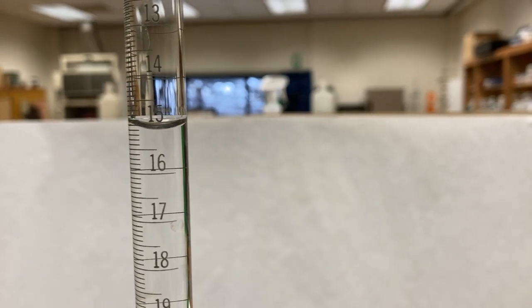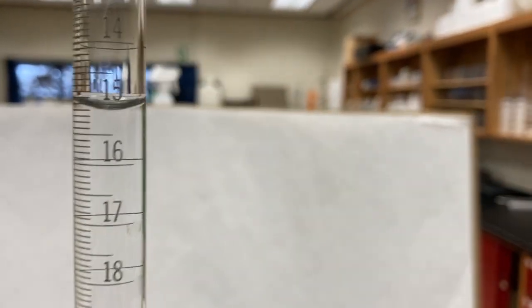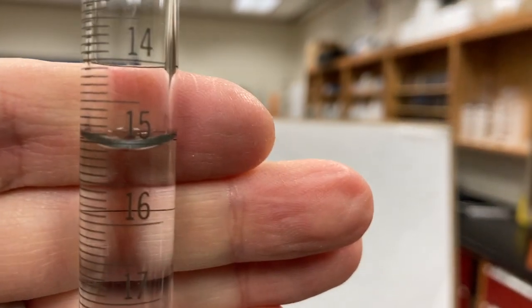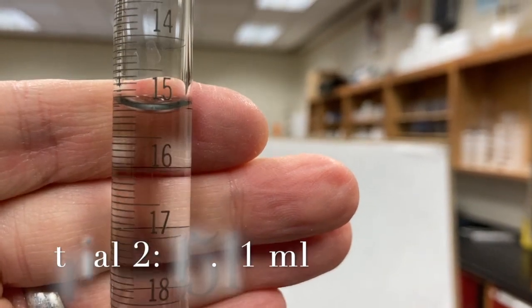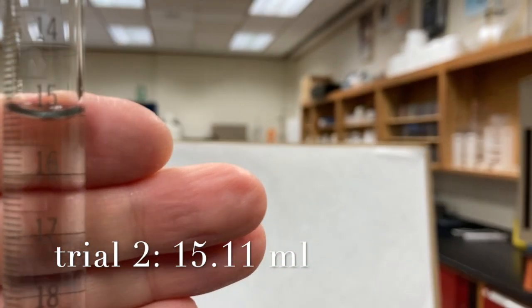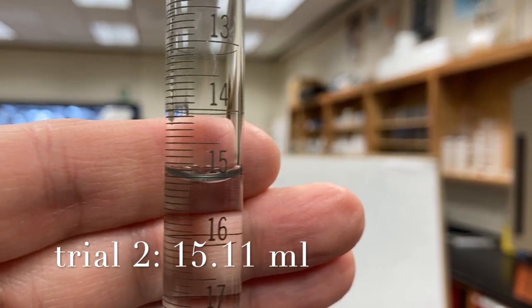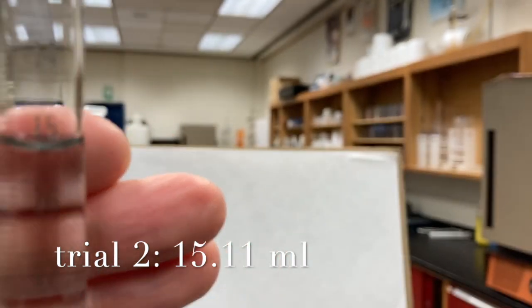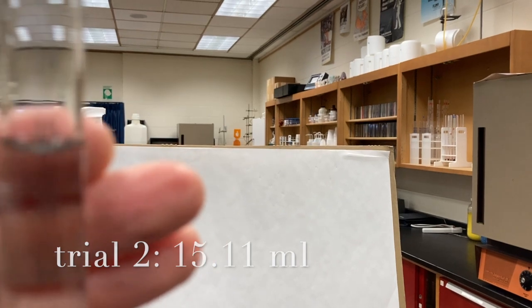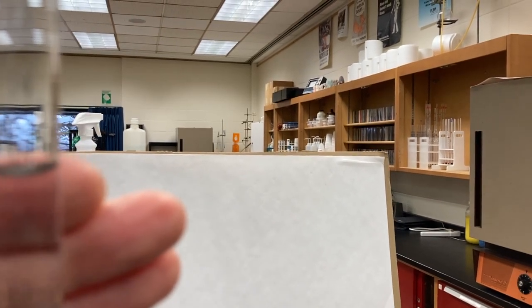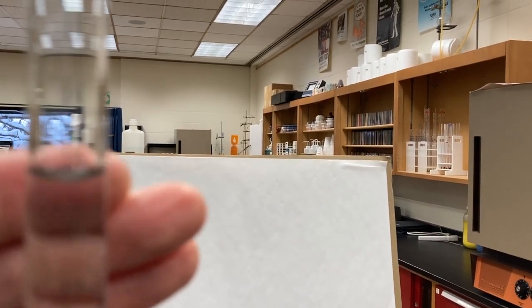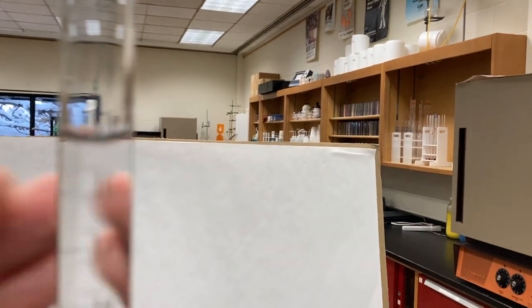So our volume is shown by the meniscus, this is just about 15.1, maybe over 15.11.